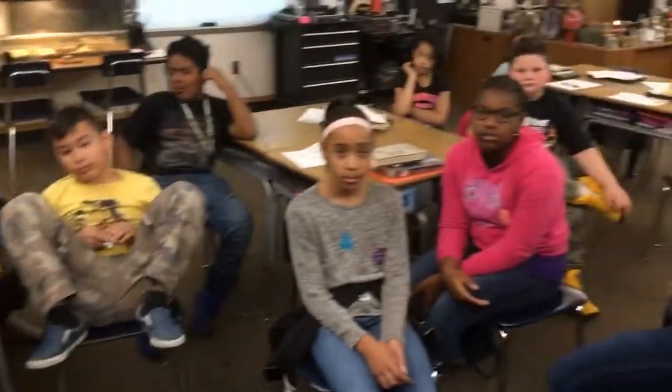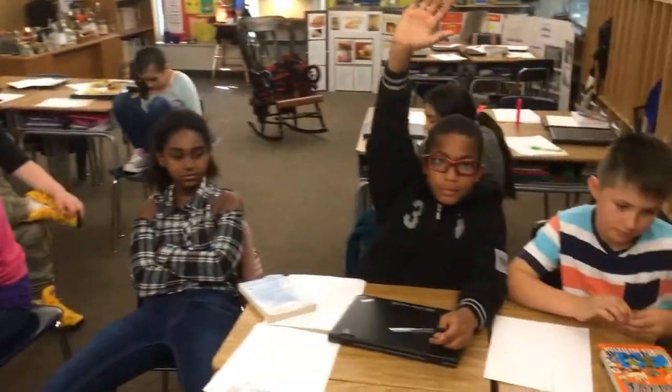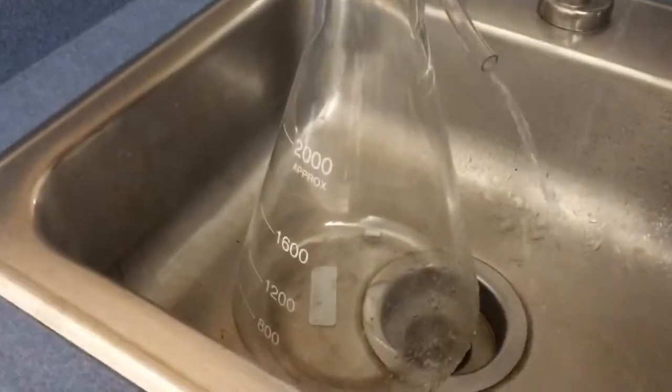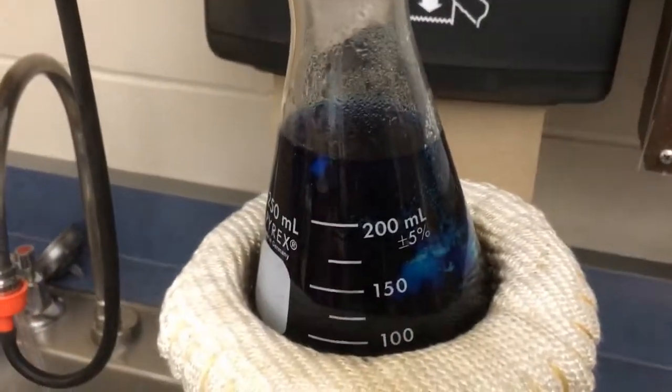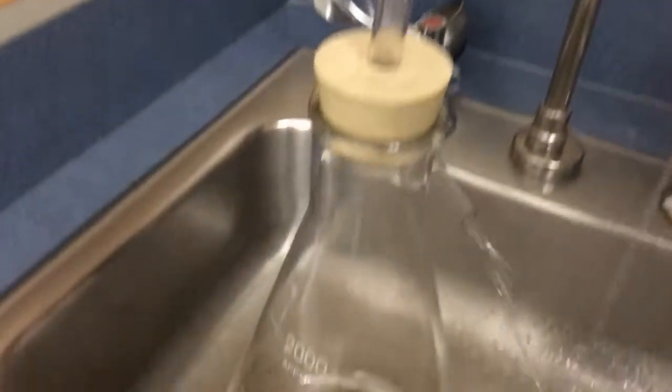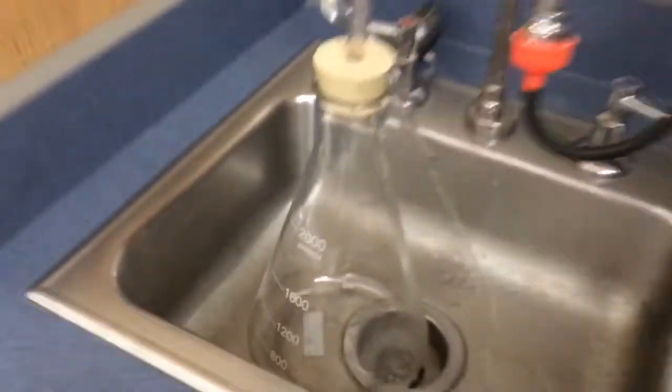What kind of water do you want collected in our streams and our rivers and our lakes? What kind of water do you want? Pure water. You want pure water. I should have pure water in this second flask. After an hour or so, I should see less water in our polluted flask as it condenses and precipitates down into pure water in our second flask.